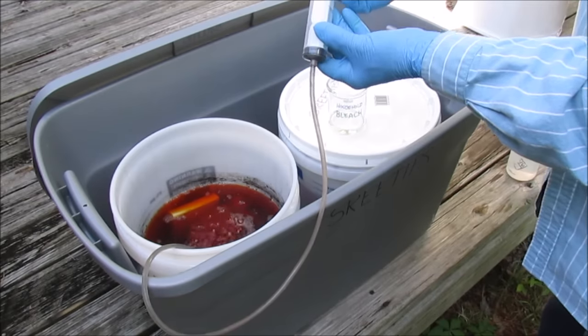Here I'm getting the solution ready to transfer inside into my fume hood. You can see there's quite a bit of chlorine being given off still from that solution. I'm going to put a lid on it and carefully walk it into my fume hood to get it in there as quickly as possible to prevent a bunch of that chlorine gas from getting all over my shop. The next step is to precipitate out the metals from that solution we extracted from the catalytic converters — using zinc.